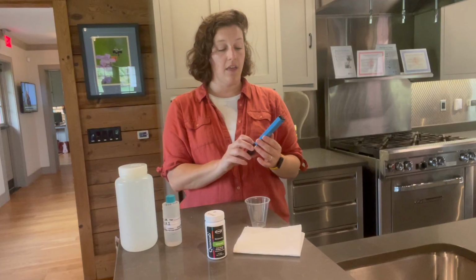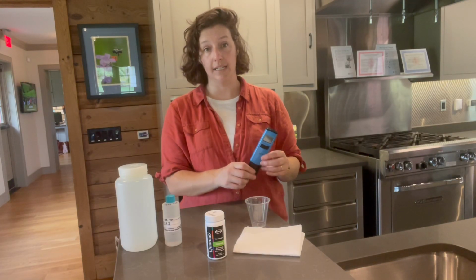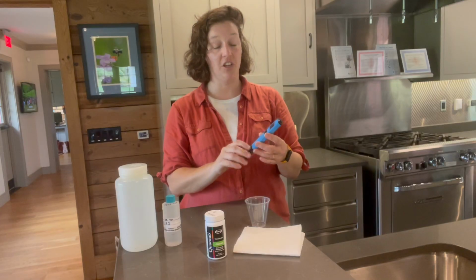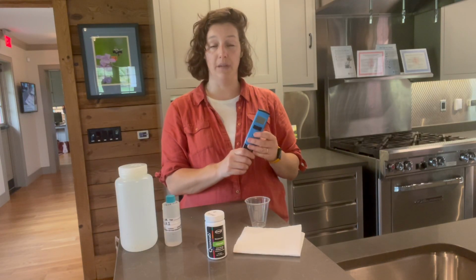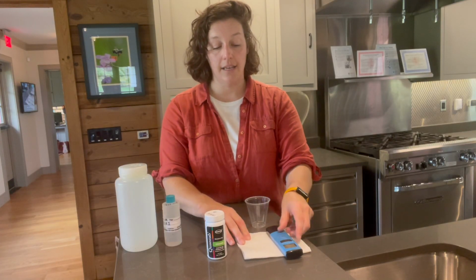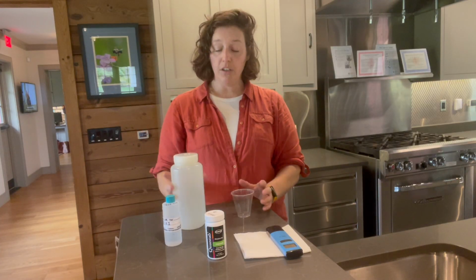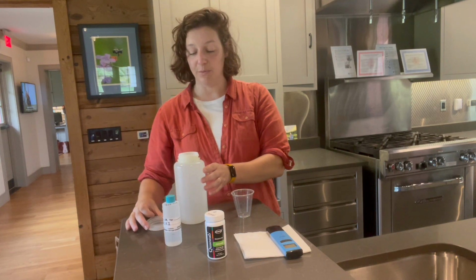Today I'm using the Hanna DIST 3 meter, which is a great low-cost conductivity and temperature meter. You can use whatever conductivity meter you would like. Just make sure before doing this testing that you've calibrated your meter to ensure that it's accurate. So if you were with us earlier for our grab sample collection, welcome back. We are going to be using the samples in a very similar way as we collected them.